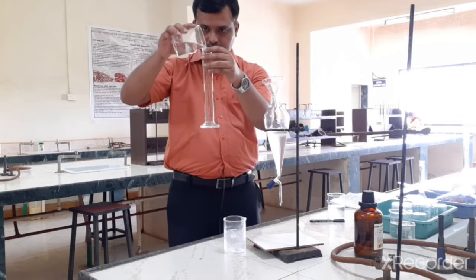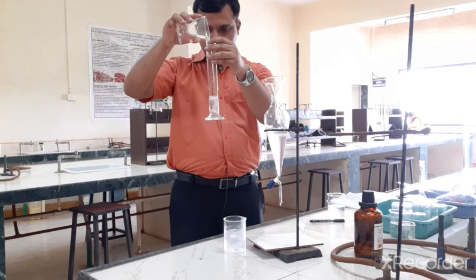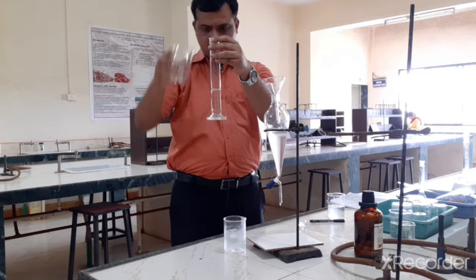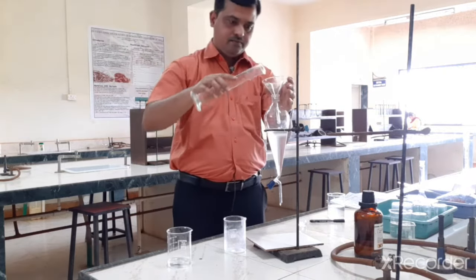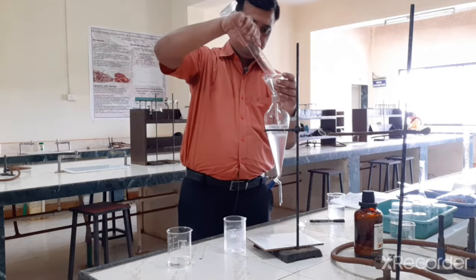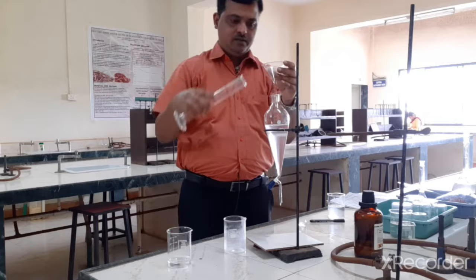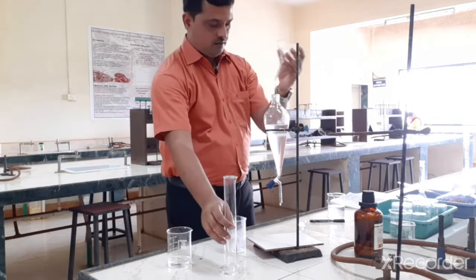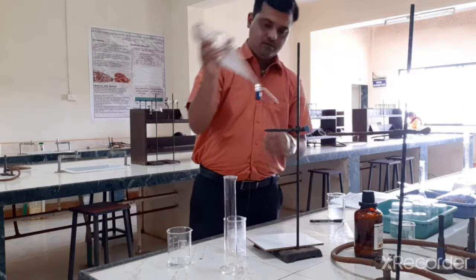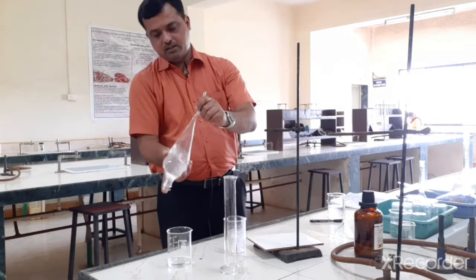So again take 50 ml of 1 molar acetic acid, and extract it.